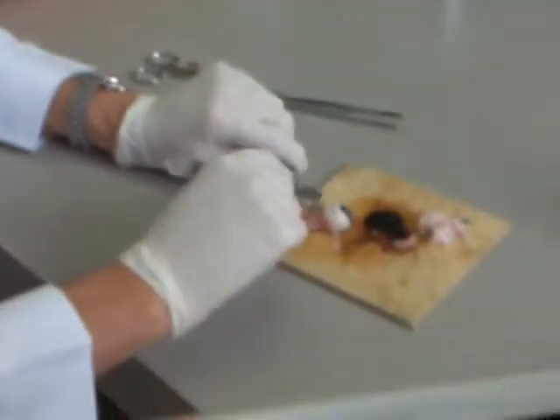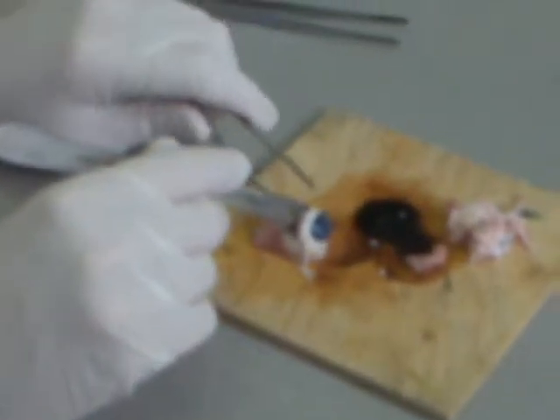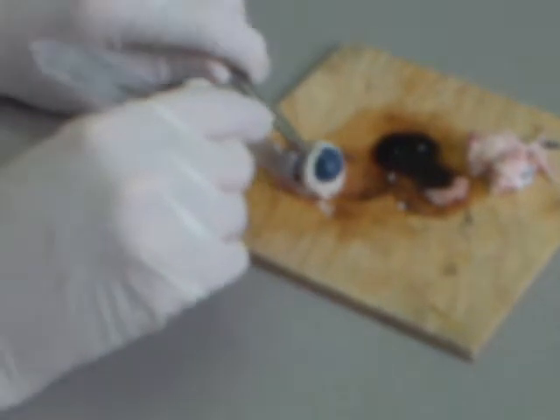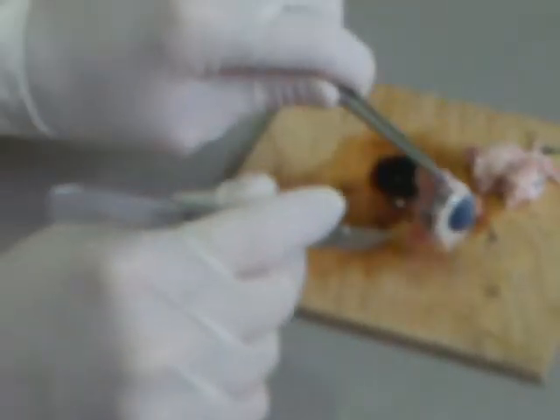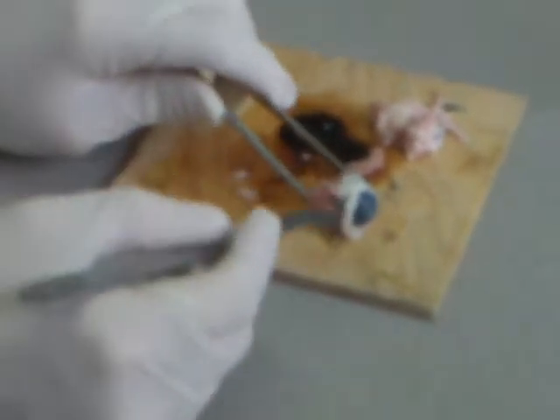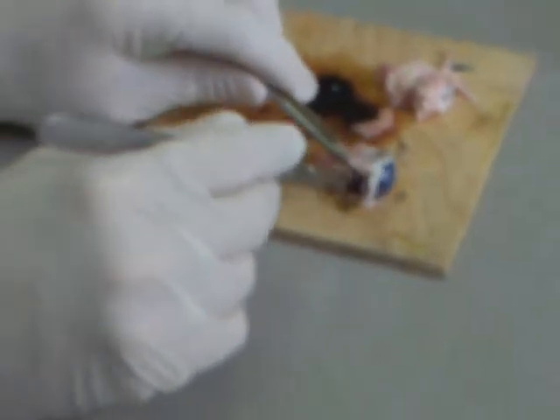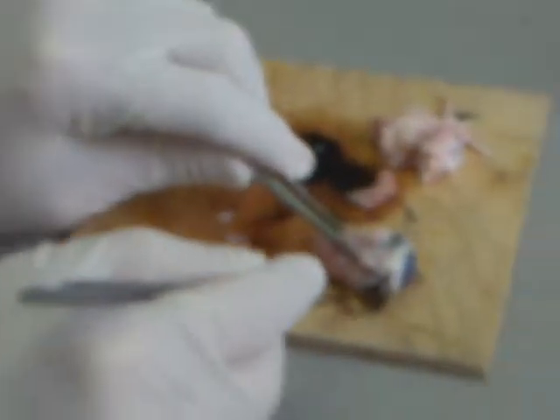If it squirts, it's going to be on me. We're in. Now straight away, like Ceci said, it's black inside and it shouldn't be — but it's transparent. The liquid itself... there's no lens visible here. This is the vitreous fluid — vitreous humor. The lens is still stuck in the front of the eye. The clear liquid you can see coming out is vitreous humor.